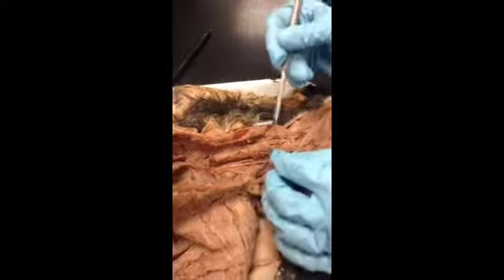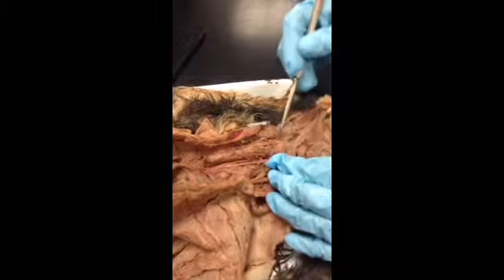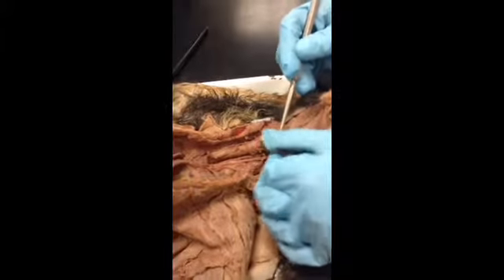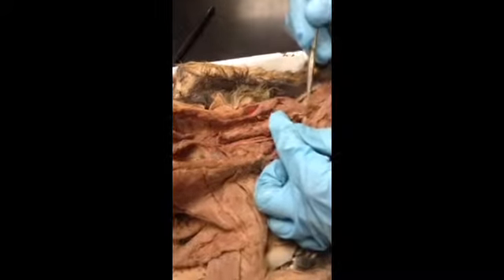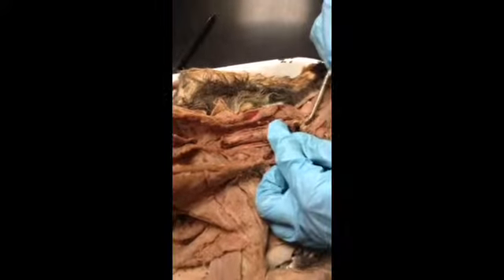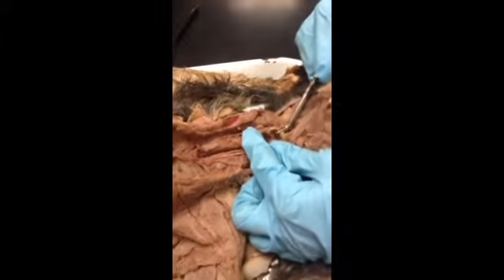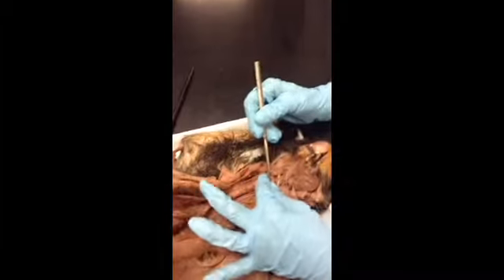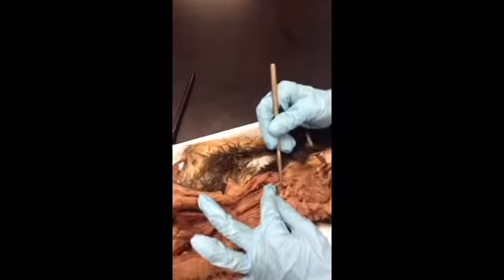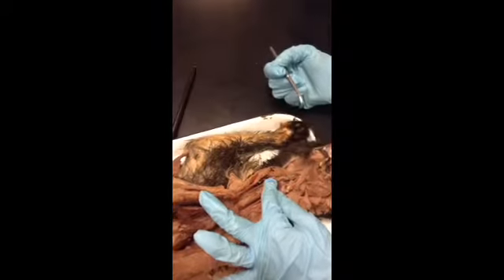Trachea. Clearly. Trachea. Up here, these big flat plates up here, this is the thyroid cartilages. There and there. If we open this up a little bit, what can we see? We can see part of the epiglottis right here. See that little leaf-like thing? That's part of his epiglottis, right up here. And these little flaps of cartilage here and here, those are the arytenoid cartilages in the cat, right there and there. Okay.